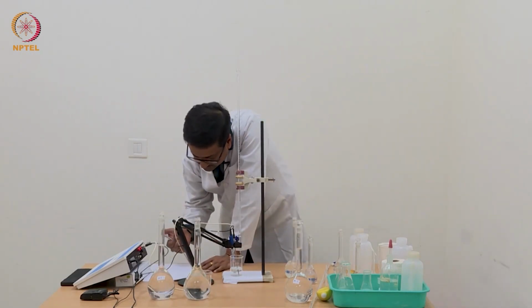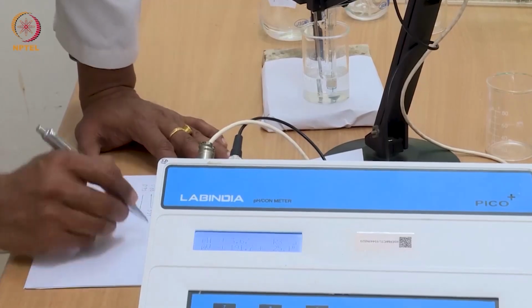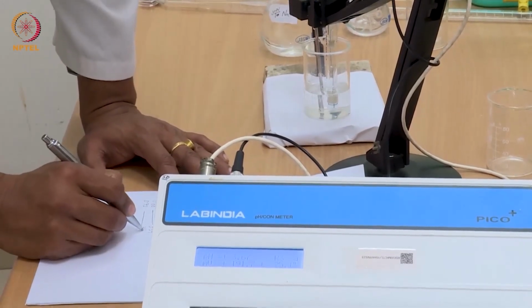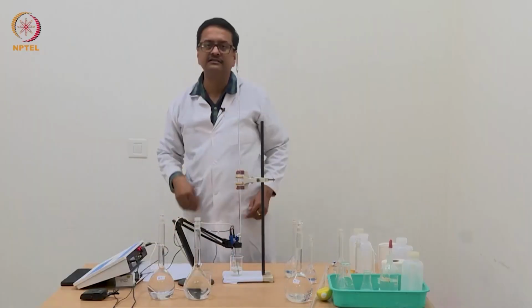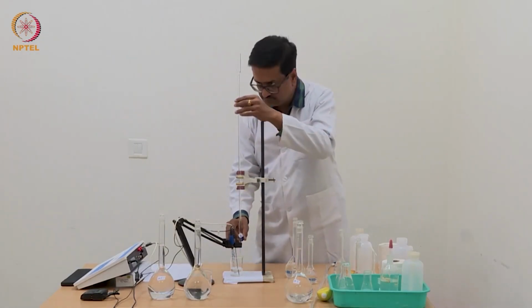So now we are at 0.72 and the pH has changed to 3.67, which is like 0.08 in terms of pH.